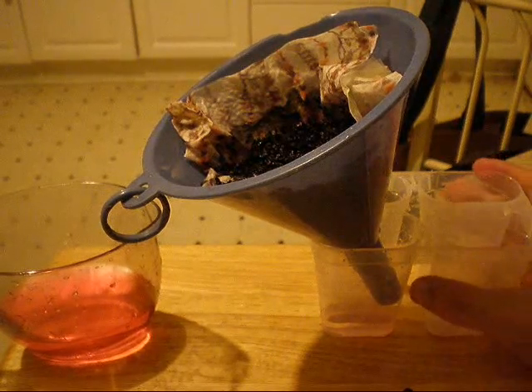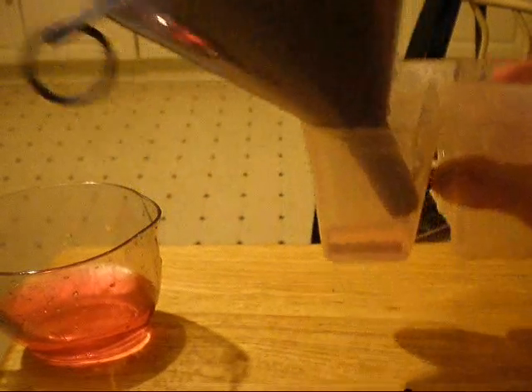And we notice the difference quite readily, that it is much, much lighter than the unfiltered water with food coloring.